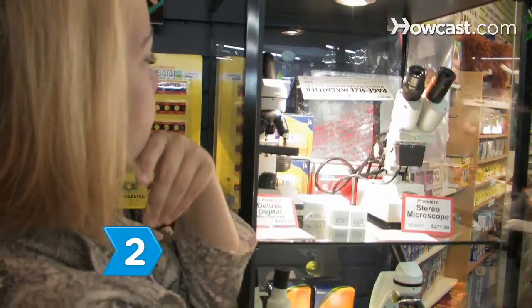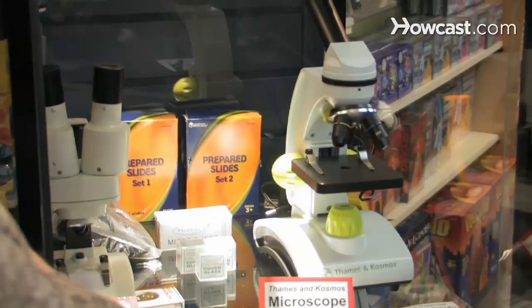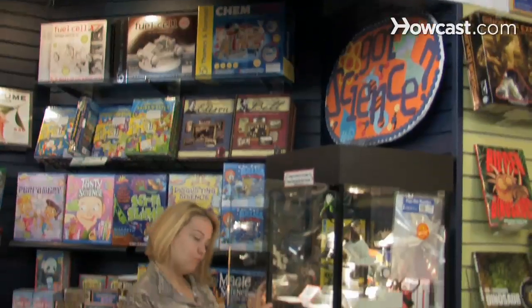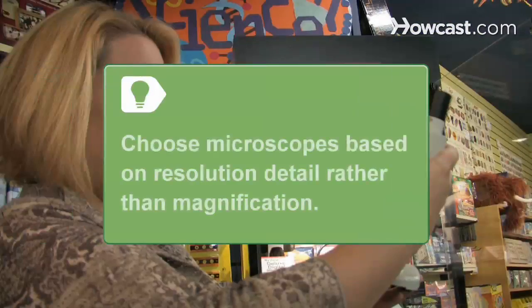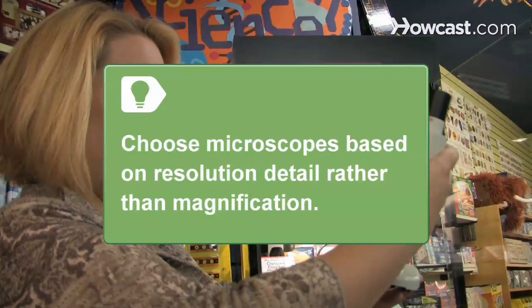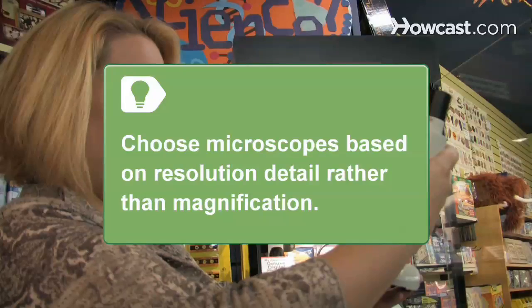Step 2. Identify whether the user will be a child, teenager, or adult to choose between a toy microscope, a student, or research model. Choose microscopes based on resolution and detail, rather than magnification, for the best quality.